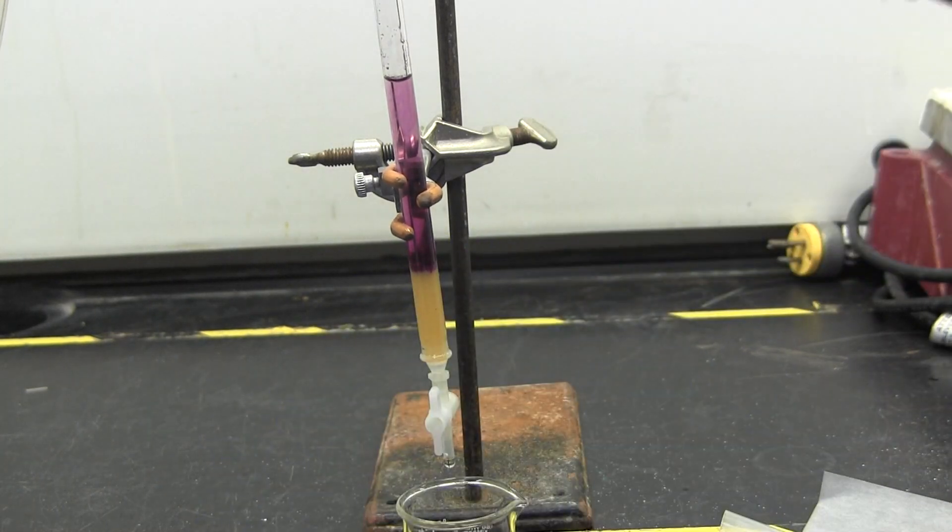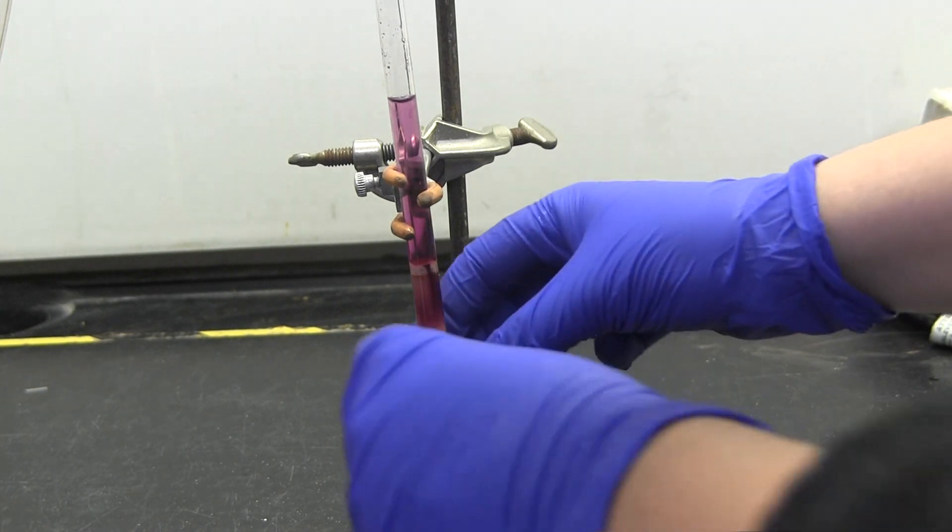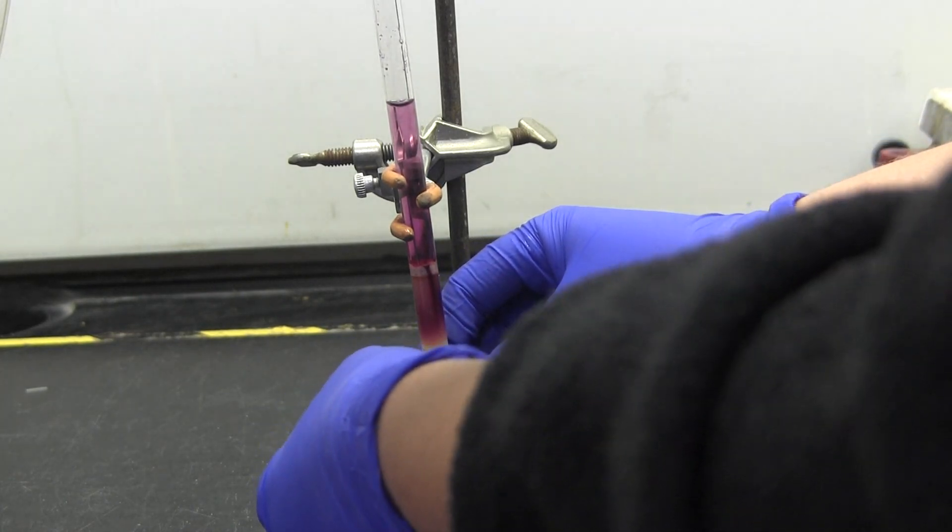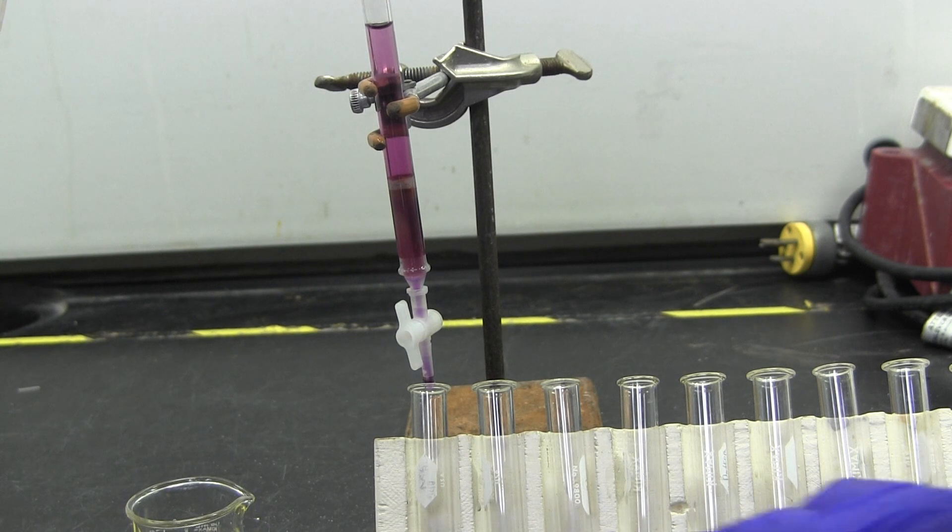Use nitrogen to push your sample into the sand. Carefully add more deionized water until it fills about twice as much of the column compared to the packing material. Begin to elute your material. If you begin to see something color eluting, continue to use water. If water does not cause your compounds to elute, you will need a stronger polar compound to separate them.